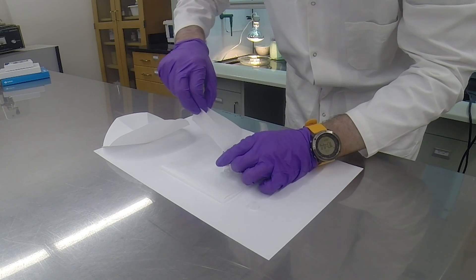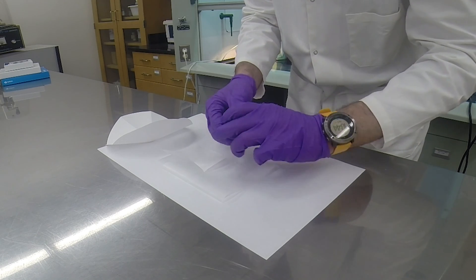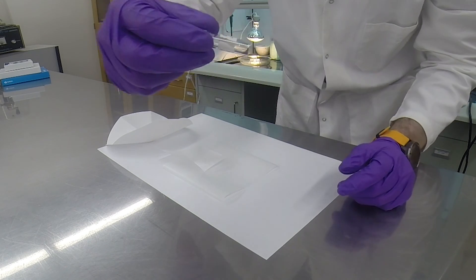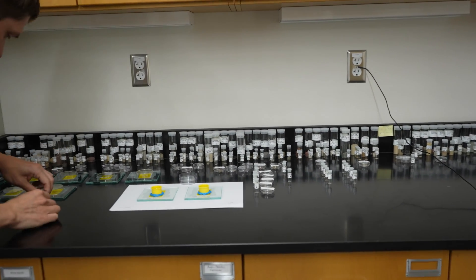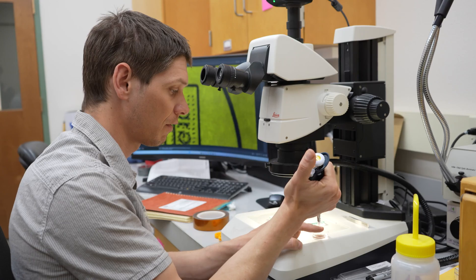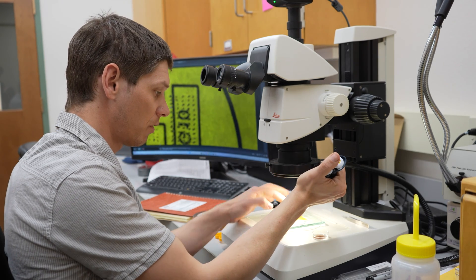We have now transformed at least a few pounds of rock into something that will easily blow away if you sneeze. We are now in the final stretch of our zircon quest. At this point, we have almost entirely isolated this mighty mineral.